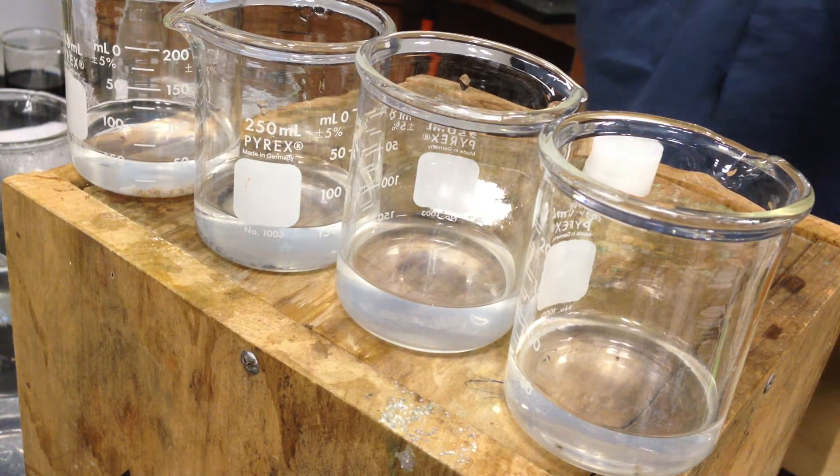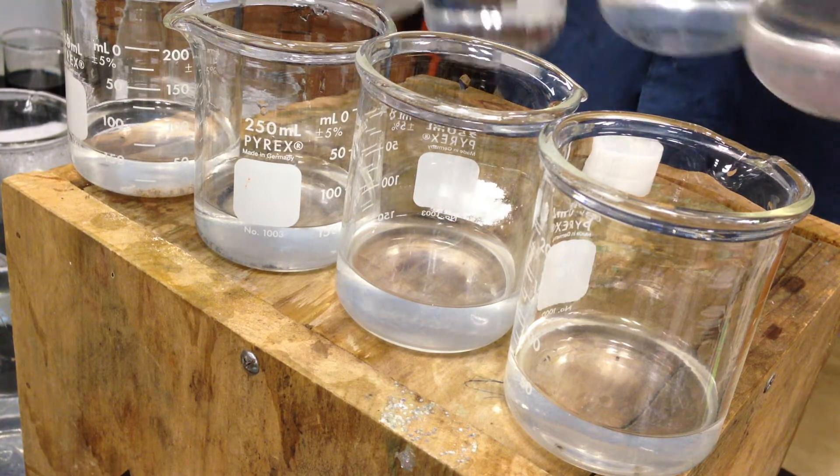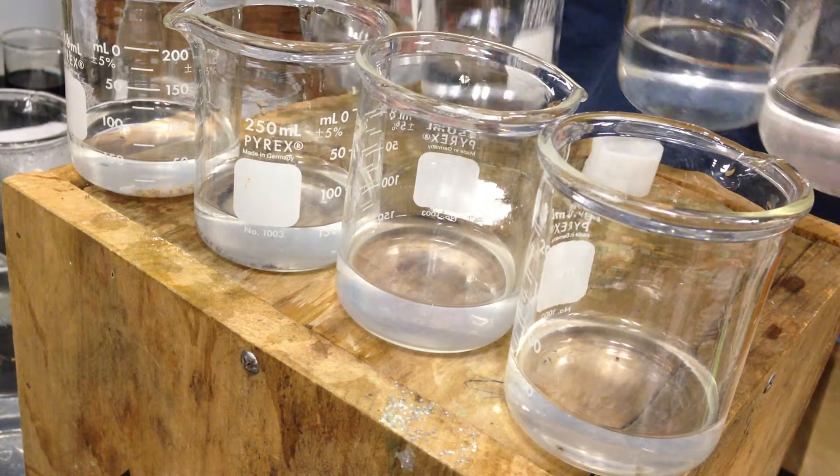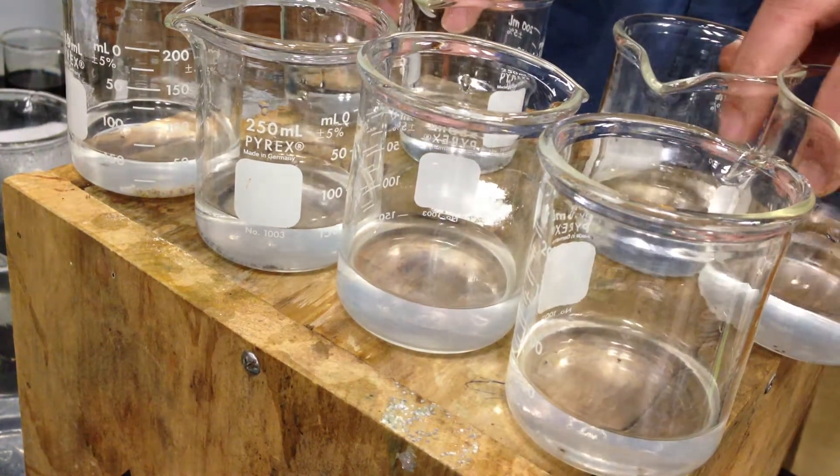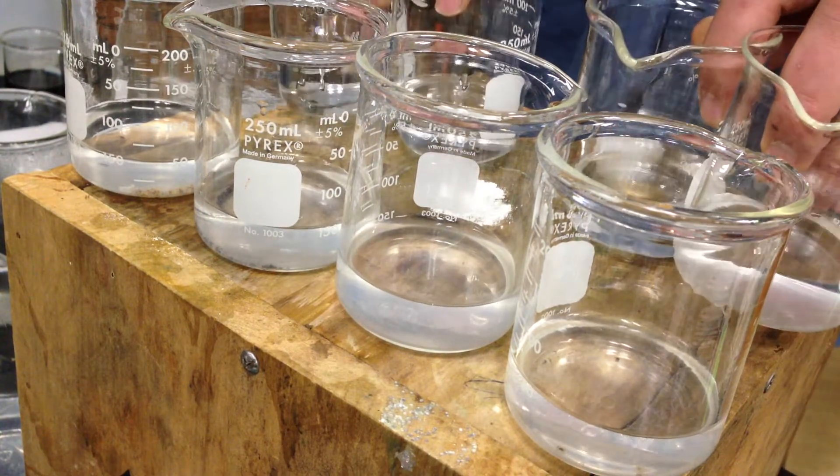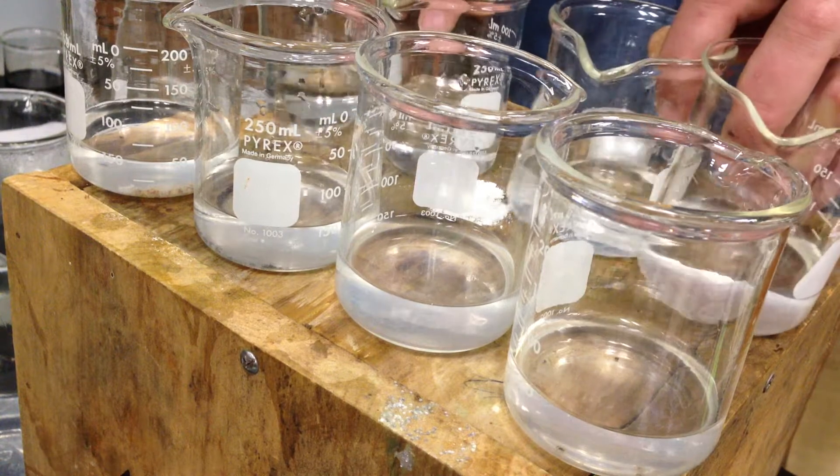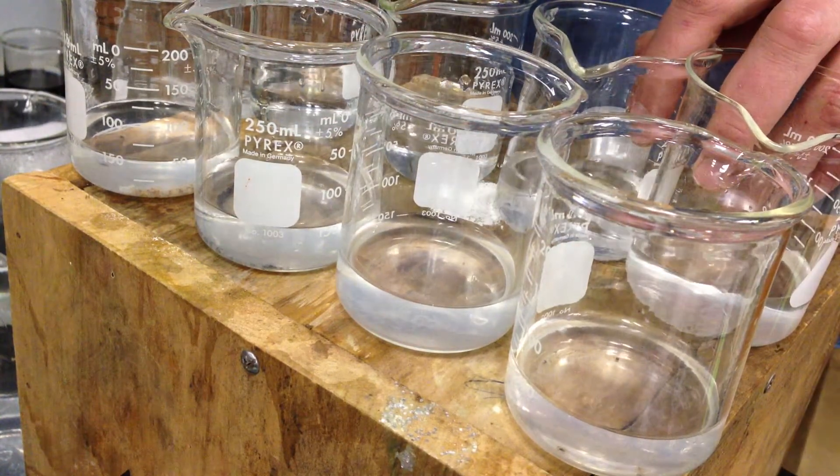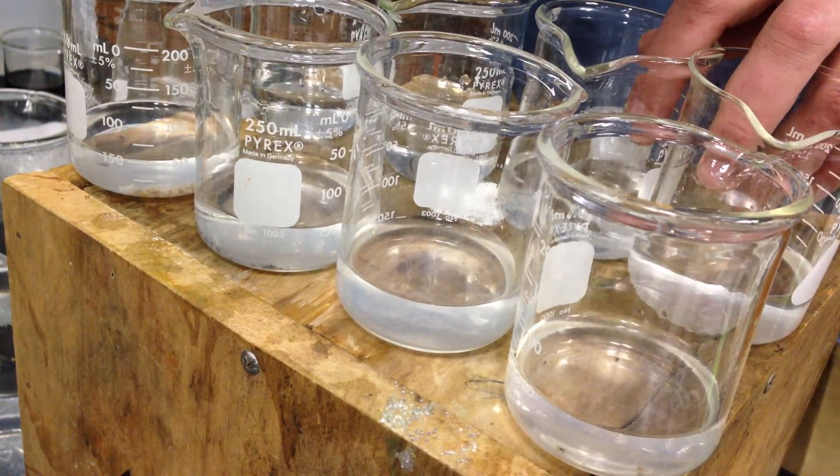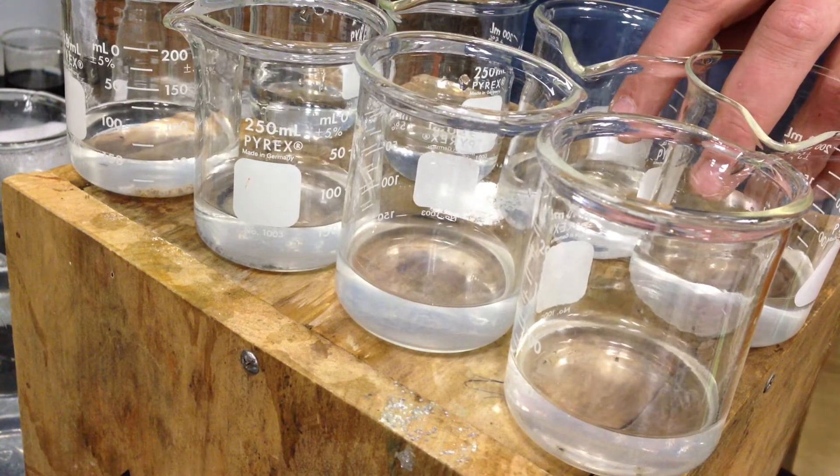Alright, so here we go. See if I can do this. Alright, you guys ready to time? Yeah. The first one should be how many seconds? Ten. And it should get slower as we go down because as I go down, I have diluted concentrations. So therefore, with diluted concentrations, the rates of reaction do what? Slow.